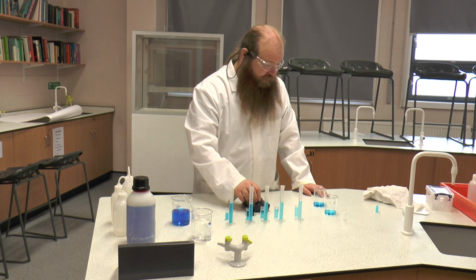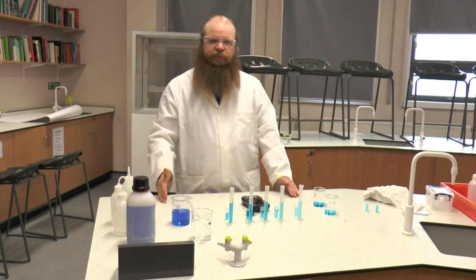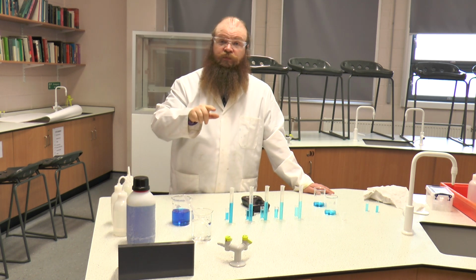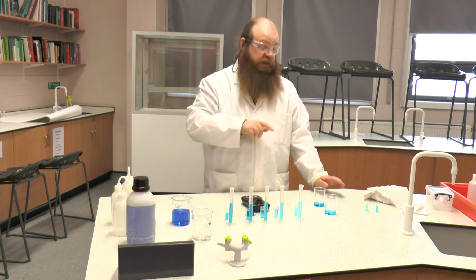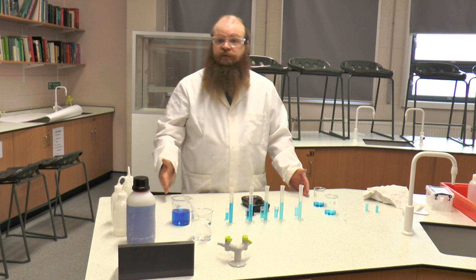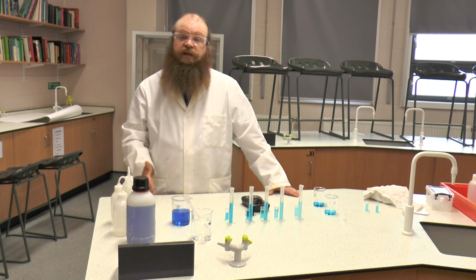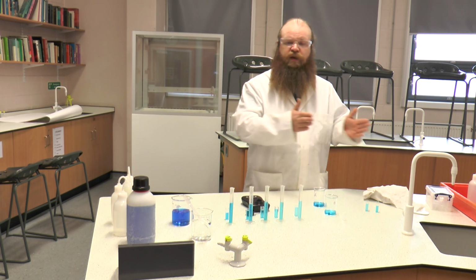Now, as our readings for A and B are in between our lowest and highest readings, it means that we can plot the readings for our known concentrations on the graph and then be able to work across and read off what the molarity of our unknowns are. If the readings for our solutions were outside the scale, so for example our highest was something like 35, if we had a reading of 60, okay, that because that's outside our lowest reading, we would then have to do some more dilutions to bring that reading within the range.